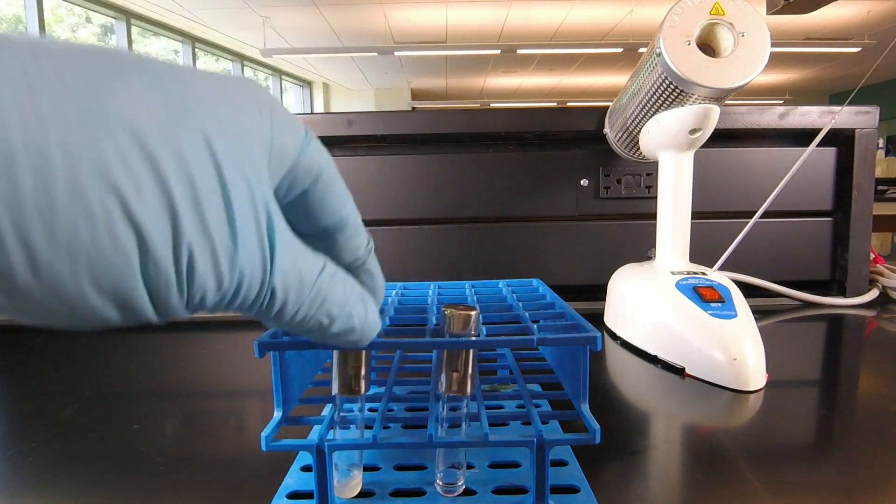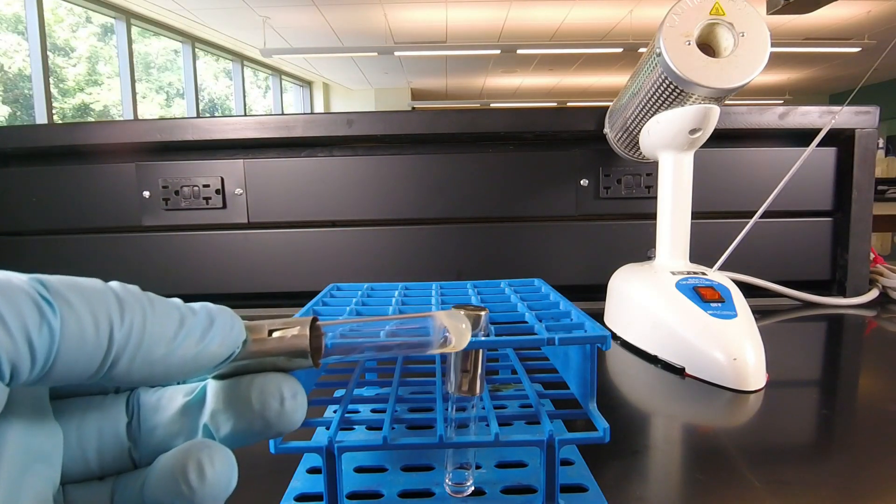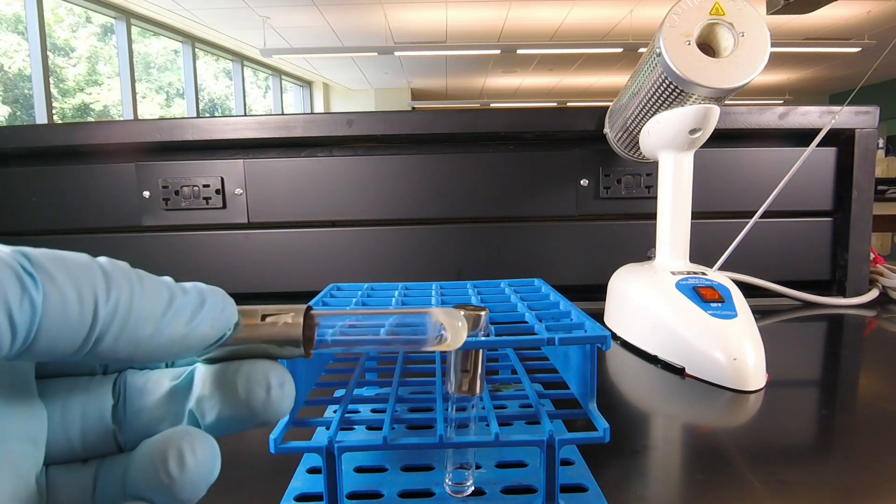It's pretty easy to recognize a coagulase positive bacterium because of the coagulation of the rabbit plasma.